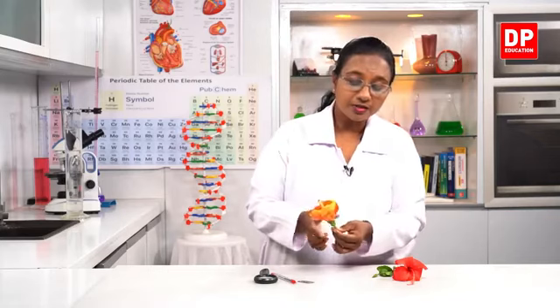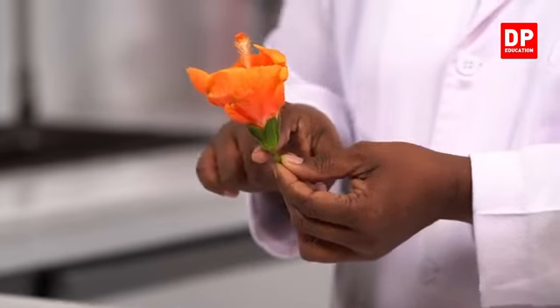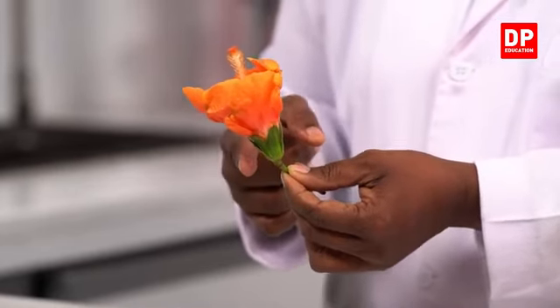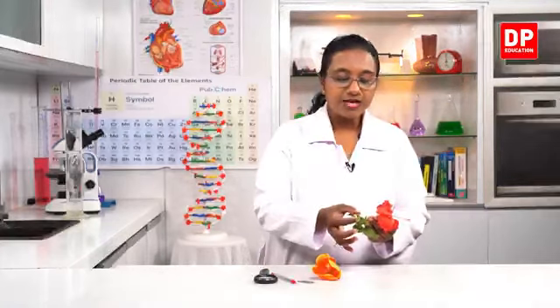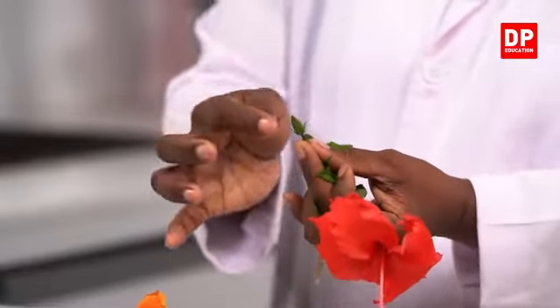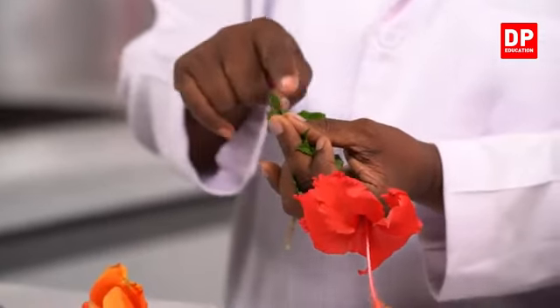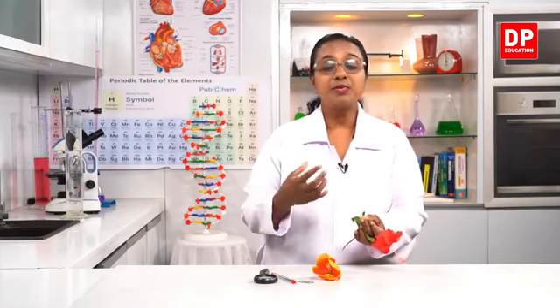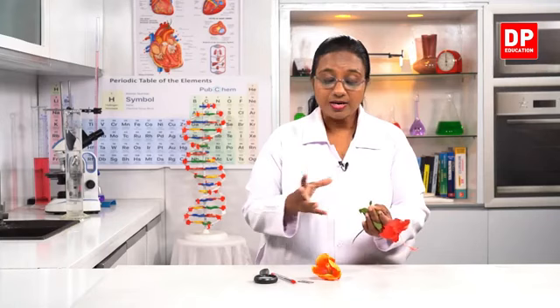So thereafter, you can see these green color parts. What are they? That is the calyx, a whorl of sepals. And here in this flower also, you can see the calyx, this one. At the same time, here this is a bud of the flower. In this, you can see all the parts. The inner parts of the flower are covered by the calyx. So the sepals provide protection when the flower is in the bud stage. Once it blooms, this is how you get the sepals.